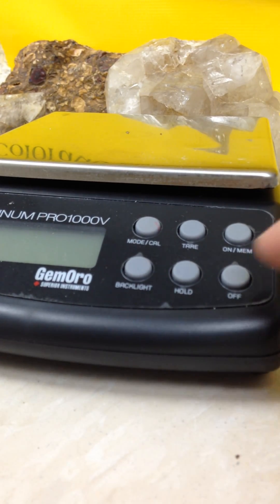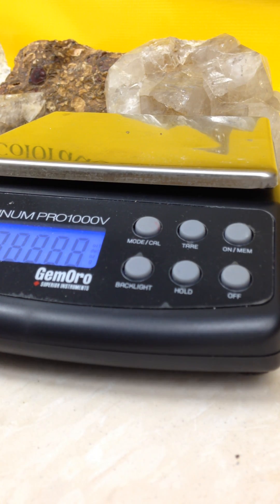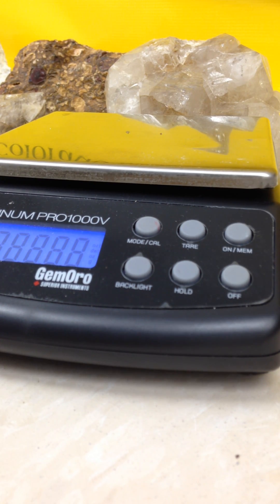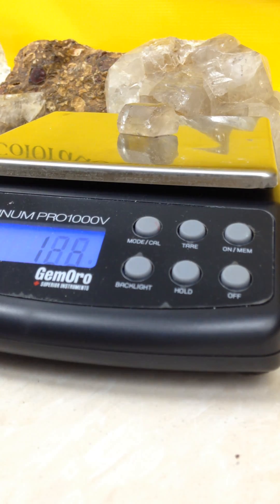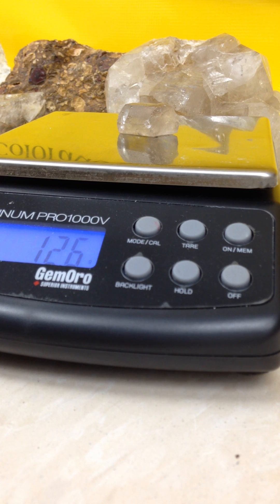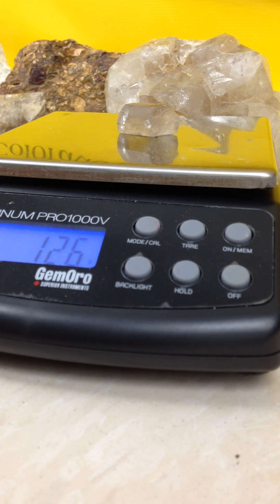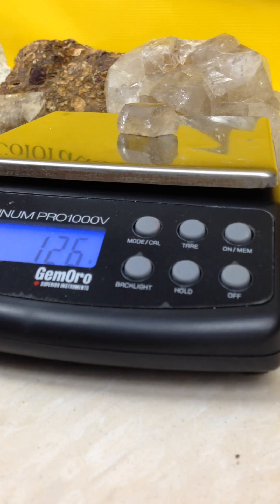The first thing you do is turn on your scale, and once it's zeroed out, you weigh your specimen. In this case it's 12.6. Write that down. I've just written down 12.6 on my pad.